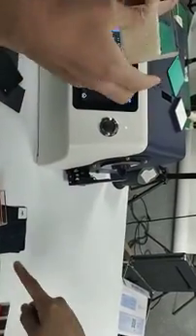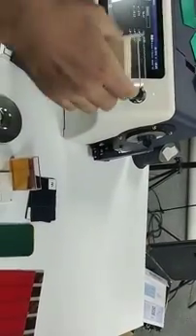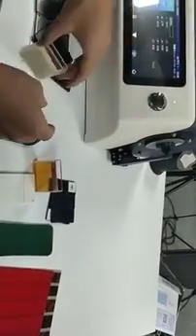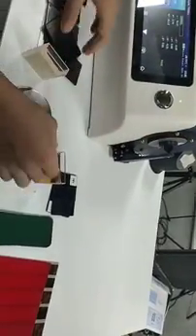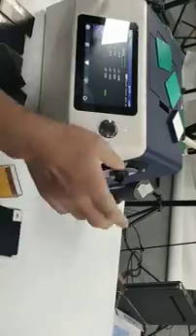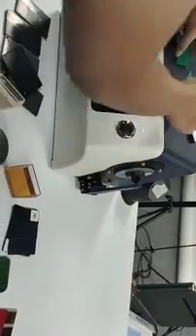For the powder. And other liquid, not transparent liquid, you can also put it here for measurement. This kind of liquid is better use than transmission measurement. Let's go to the transmission.